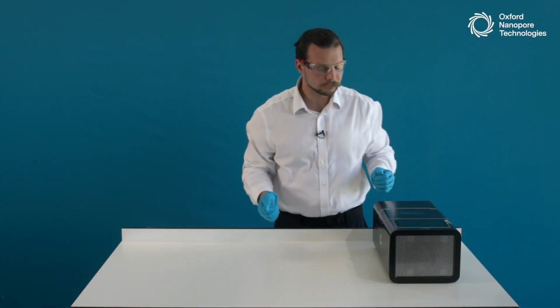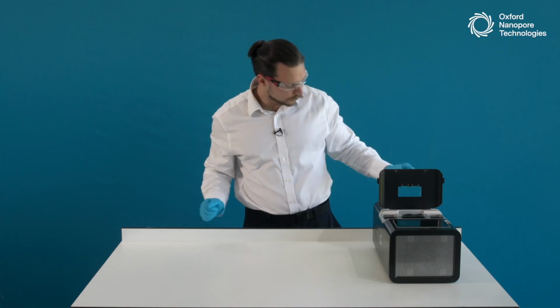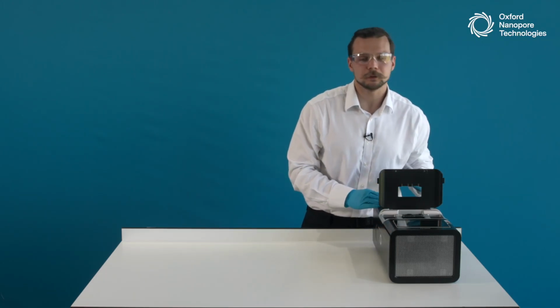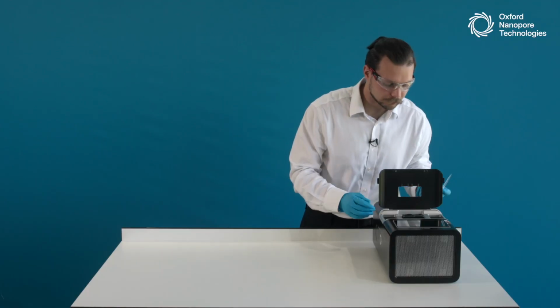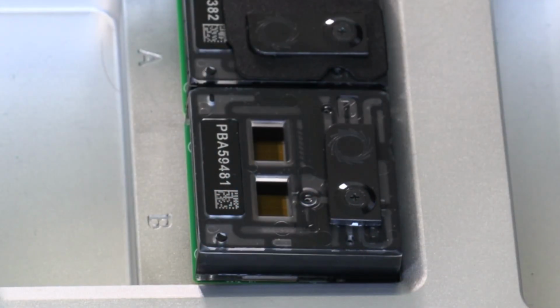Now, gloves are on. We can actually take a look at the flow cells themselves. Before we proceed with the flow cell loading, I believe there are a few parts of the flow cell that are useful to know about and pay attention to. So I will open the valve that's located on the flow cell by rotating it 90 degrees. And a few parts that are useful to note.